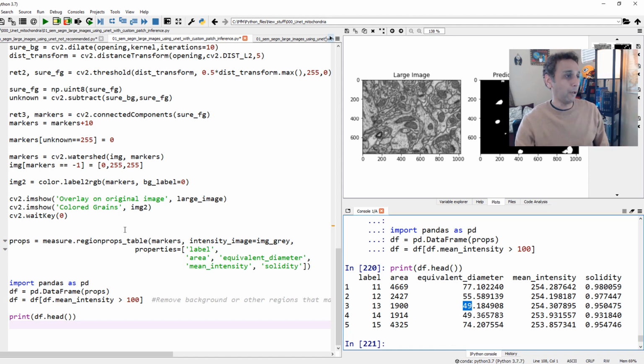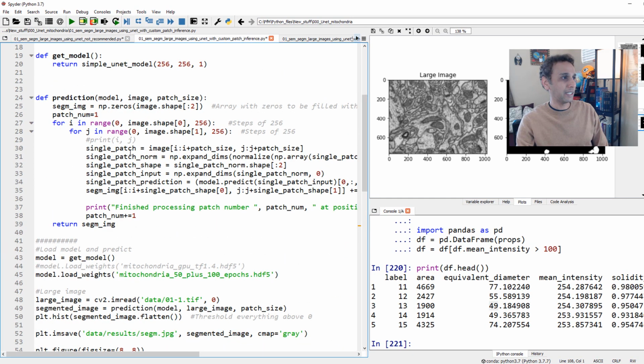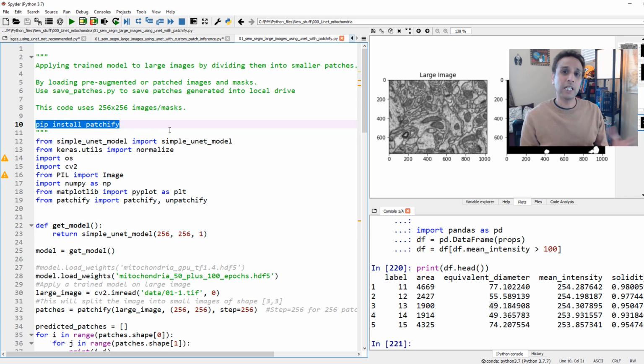Okay. Now, if you don't know how to deal with these nested for loops, if you're just getting started with Python but you're dangerous enough to kind of play with U-Net, okay? This is for you guys. There is a library called Patchify, okay? Go ahead and pip install patchify. And as the name suggests, it takes care of patching and unpatching. So it patches the images, it unpatches. In between, you can do whatever you want with those patches.